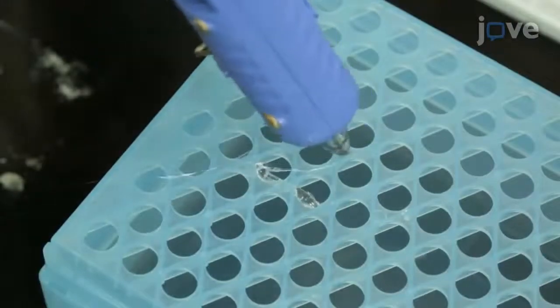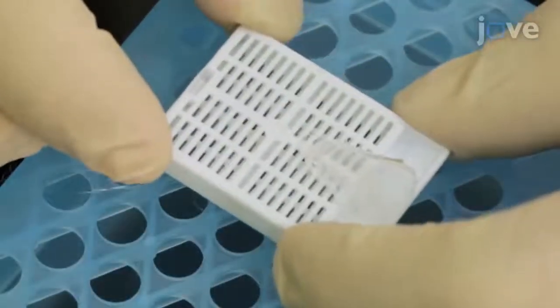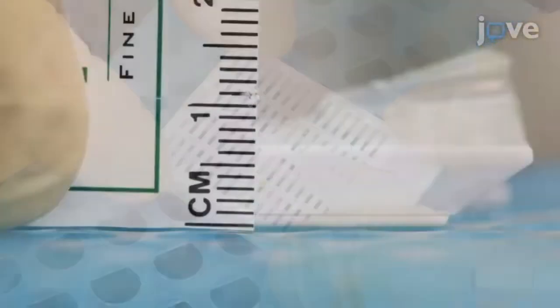Next, glue a tissue-embedding cassette onto the box where it can support the pup's torso while its head is fixed.